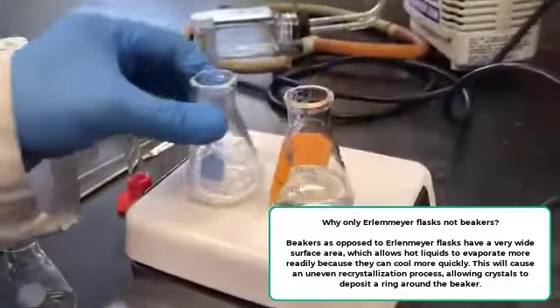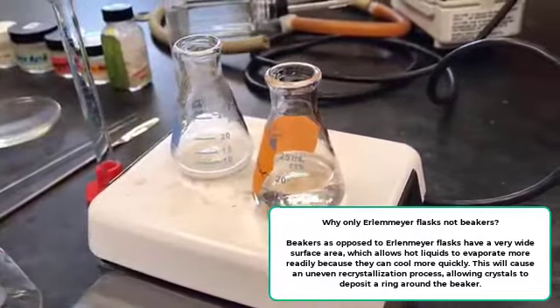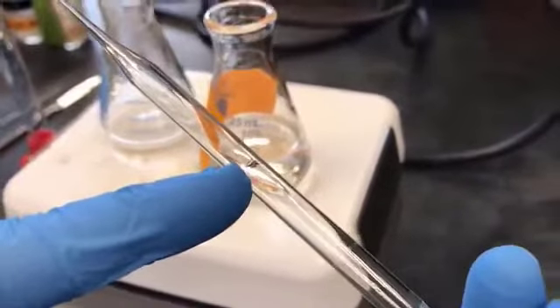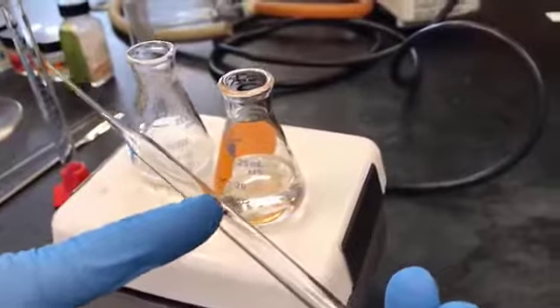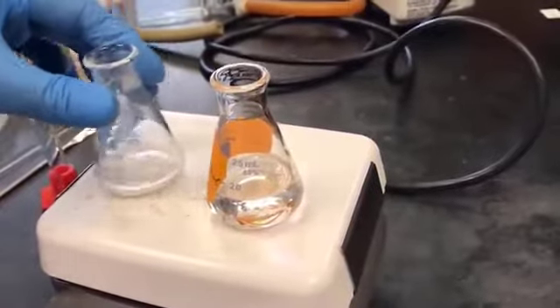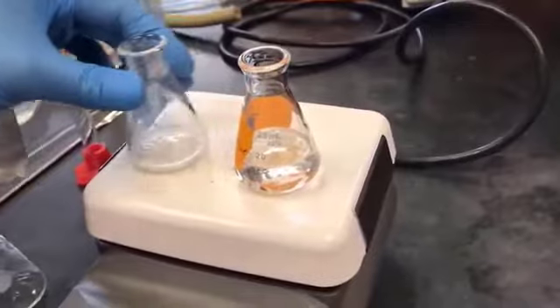So I've added about 1 milliliter of the boiling ethanol into it. As you can see, I made a mark just for reference. So here comes about 1 milliliter. I measured it using the measuring cylinder, and that's how it came to about 1 milliliter, and that much I have added, so that I know I have added 1 milliliter so far. And then I'm going to add 0.5 milliliter at a time.